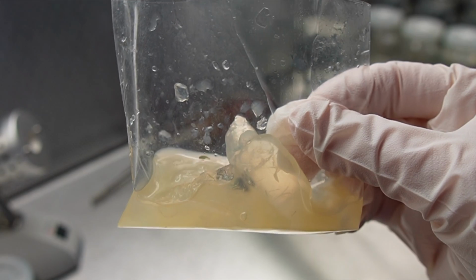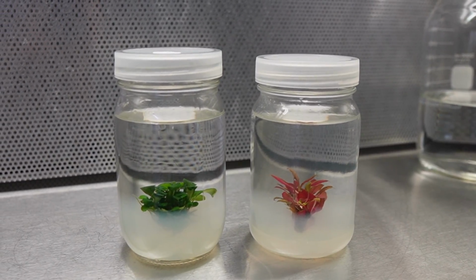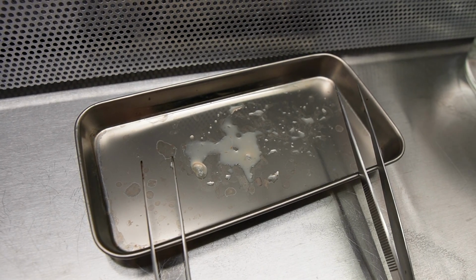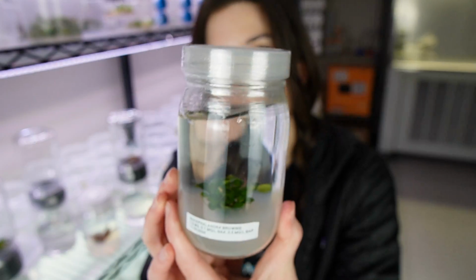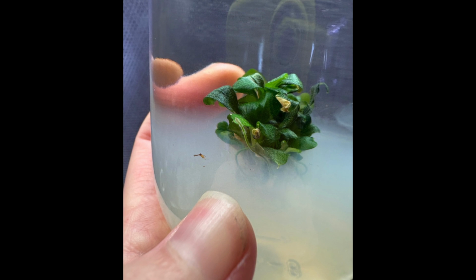The Cardinalis media honestly looks a little nasty. The same Cardinalis plants also left this foul residue behind, which is not typical and gave me an ominous feeling. While I was admiring my work, I noticed something weird. There was a dead bug in my Bucephalandra. I felt like I had just discovered a finger in my McDonald's french fries. Thank you to Instagram, the intruder was identified as a fruit fly.